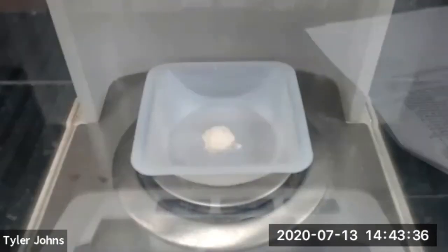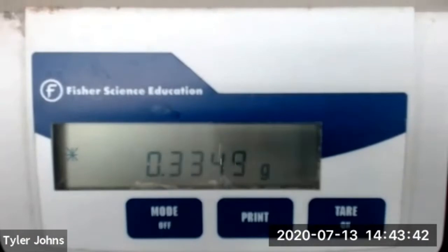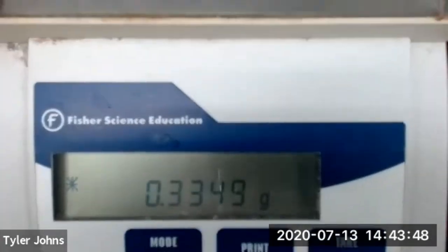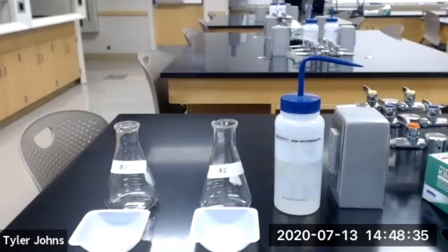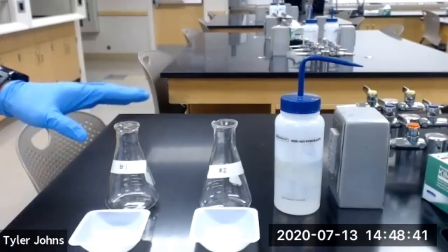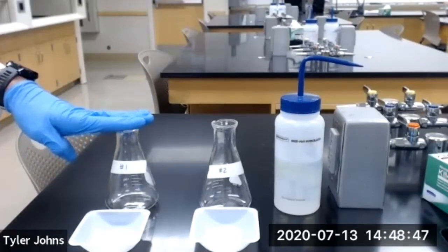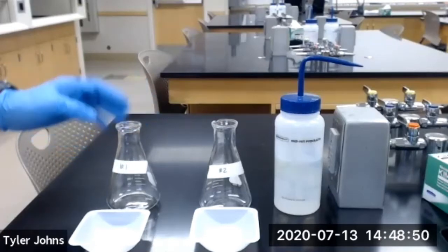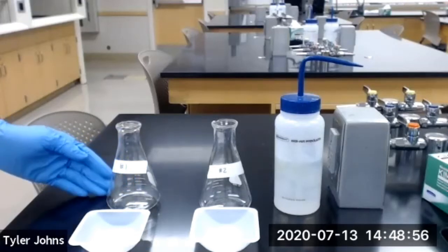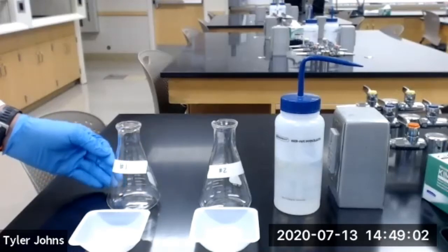The mass of the second half of the tablet, which we will be using for trial number two, is 0.3349 grams. We're next going to analytically transfer each half of our vitamin C tablet into a corresponding 250 milliliter Erlenmeyer flask, and then we're also going to add up to 75 milliliters of deionized water to each flask in order for the vitamin C to dissolve. Don't be concerned if all the powder does not dissolve — tablets contain various binders and fillers which may not dissolve in the water.